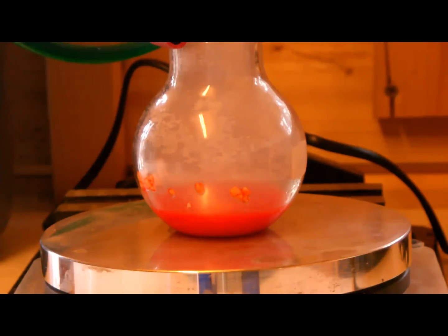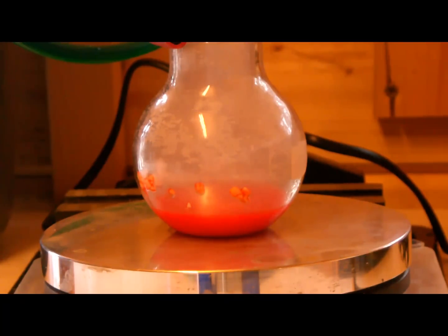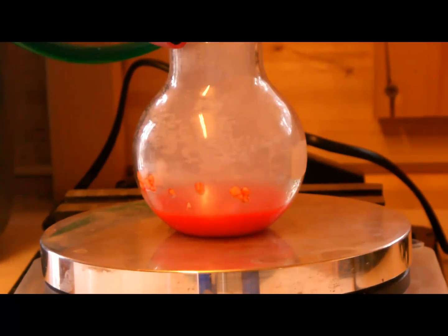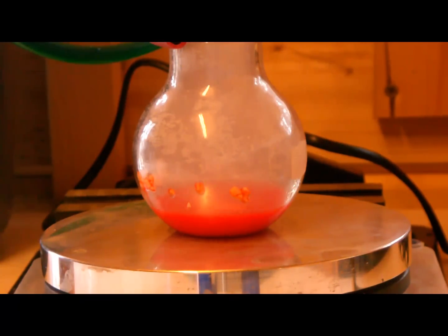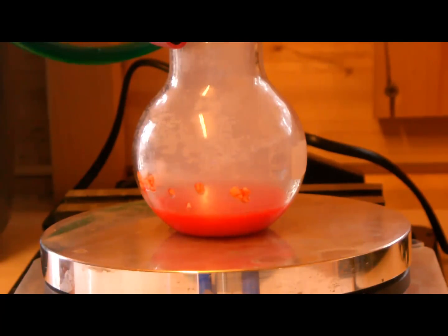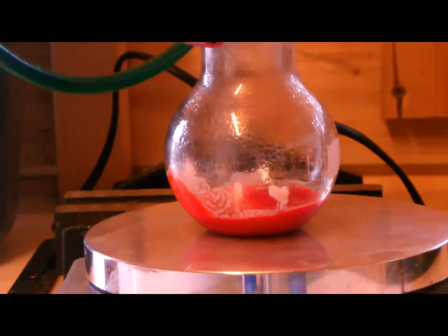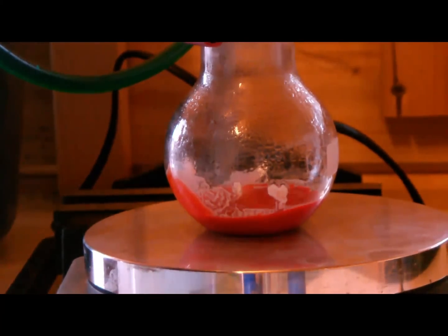For best efficiency, let the whole mixture react for 15 to 30 minutes. You can also let it stir overnight, but it isn't very necessary. However, if you want nearly 90% efficiency you should do this. You can see the droplets on the wall of the flask due to condensation during the reaction.